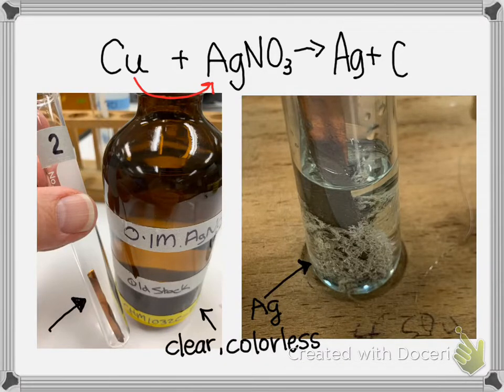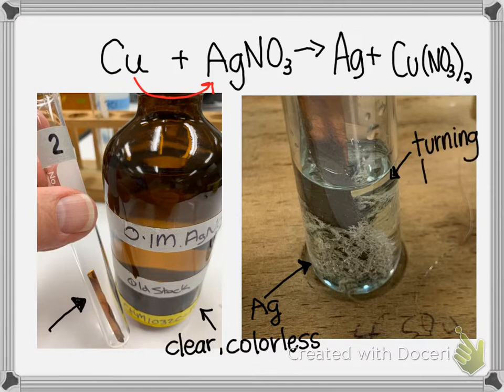So copper nitrate. Now, here's an observation. If you can see here, the solution is starting to turn blue. That's because copper nitrate is blue.